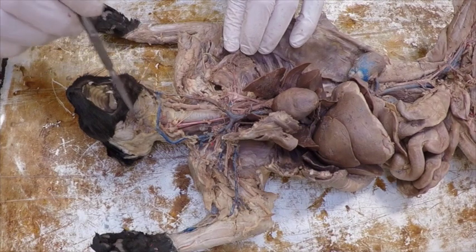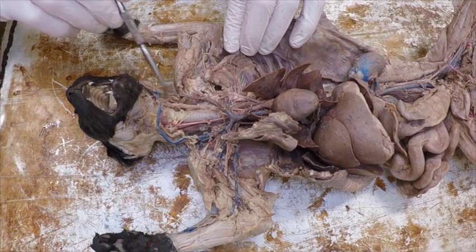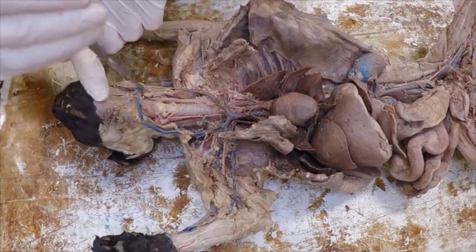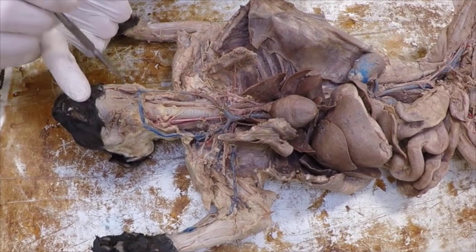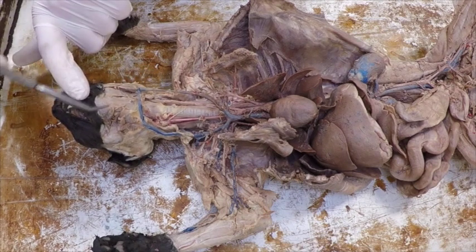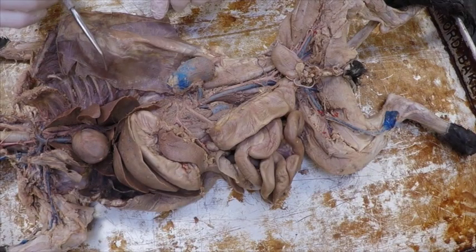They did not investigate all the ones going into the face, but there are a number of them. If they wanted to, they could dig deeper into the tissue and find what's called the lingual going towards the tongue. They could find an anterior facial, and they could actually find a temporal artery that is going towards the temples of the cat. Those are all in there if they follow these carotids, but this particular group didn't decide to do that. We're going to continue with the rest of the arteries.